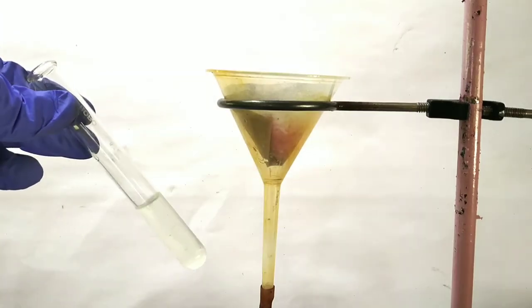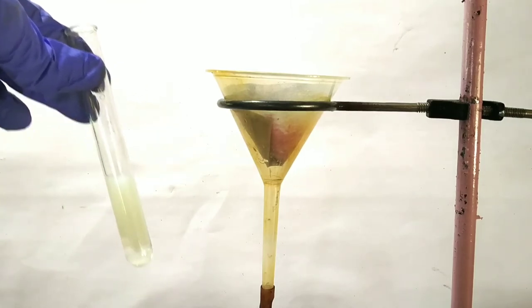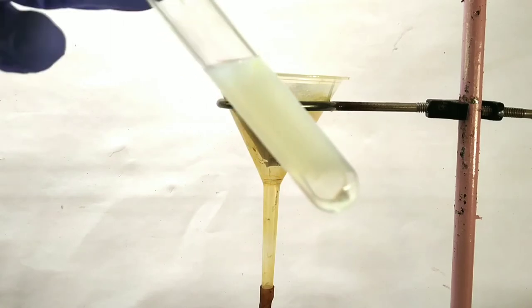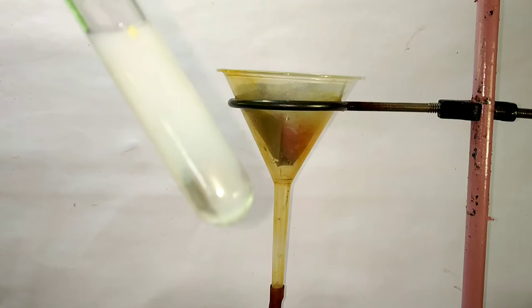The solution should be washed 2 to 3 times with distilled water to remove chloride ions. We can test the presence of chloride ions by using silver nitrate solution, which gives a white precipitate of silver chloride if it is present.